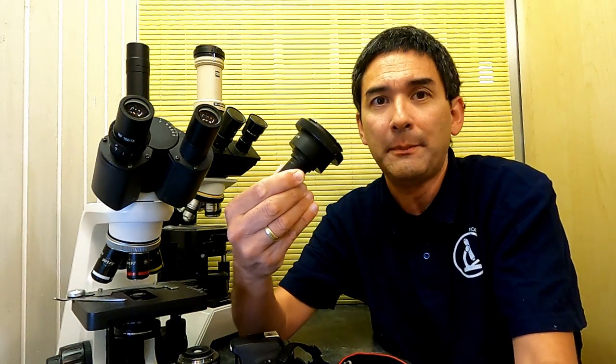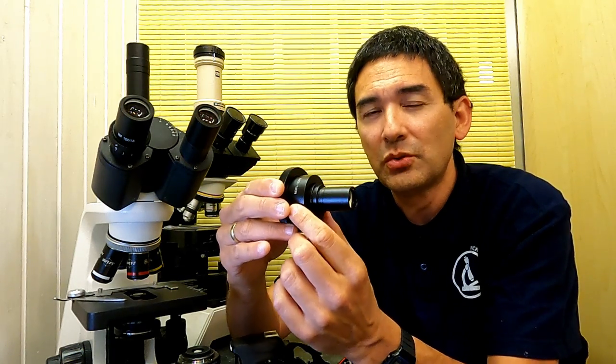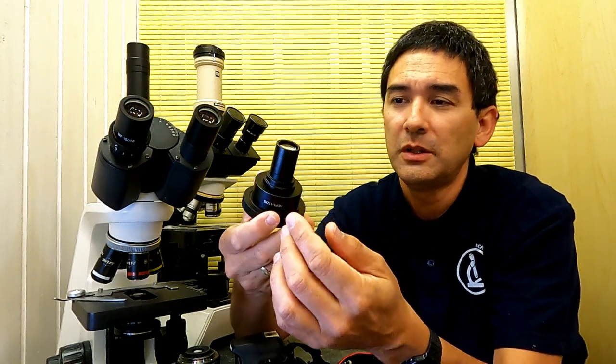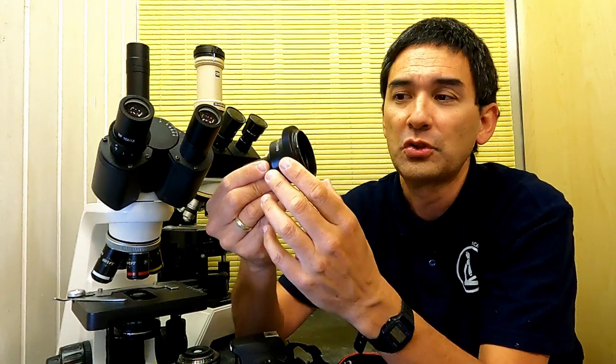I have already made a few months ago a review of another adapter, which does not contain this diaphragm. And this actually does work. Now I'm not super happy with the quality, especially when you connect it to a stereo microscope. So it's a little bit fuzzy and blurry on the edges, but it works at least, and it is parfocal. Yeah, so this is okay. Yeah, I can say that considering that the price is not too high, it at least works, right? But this one over here, I'm really frustrated.